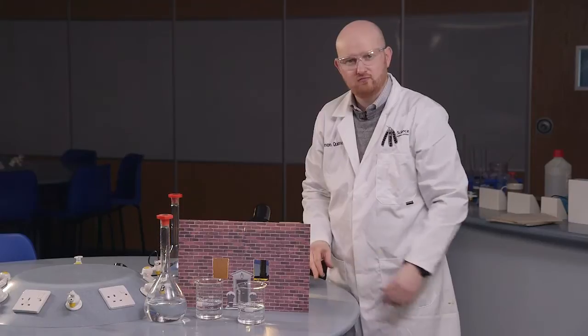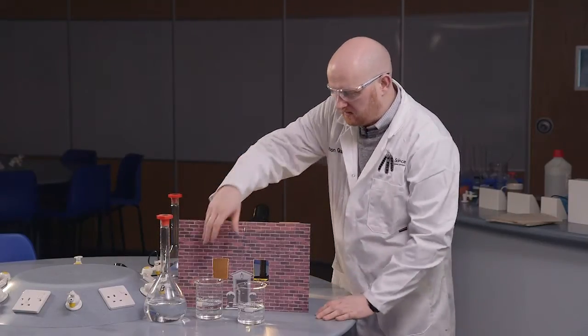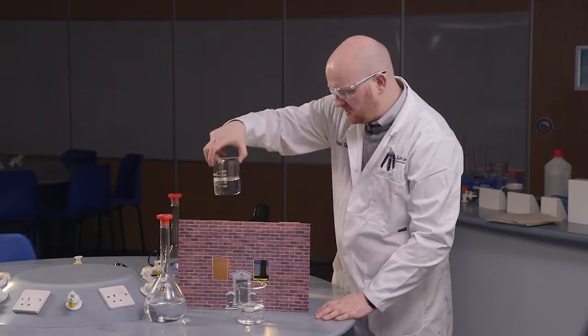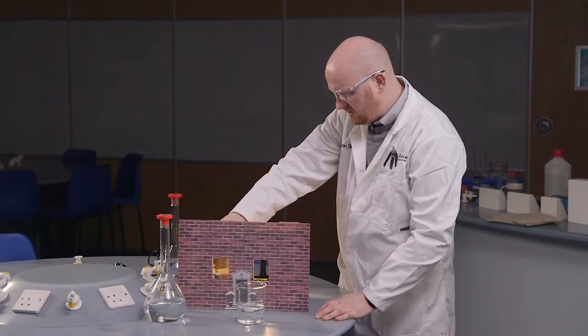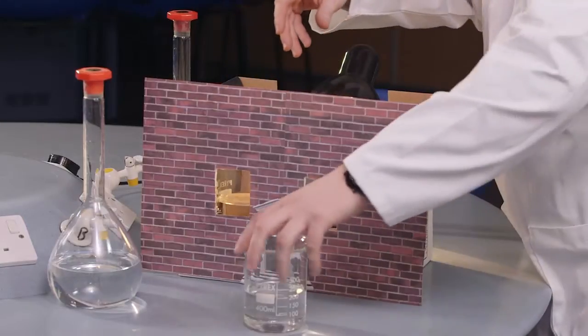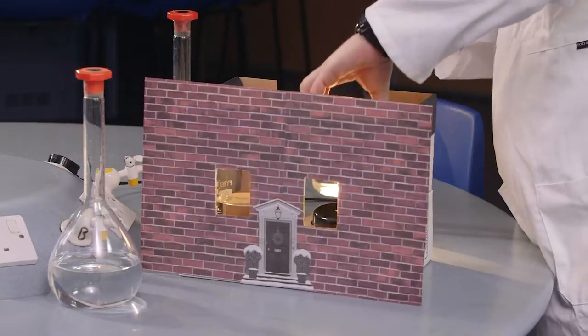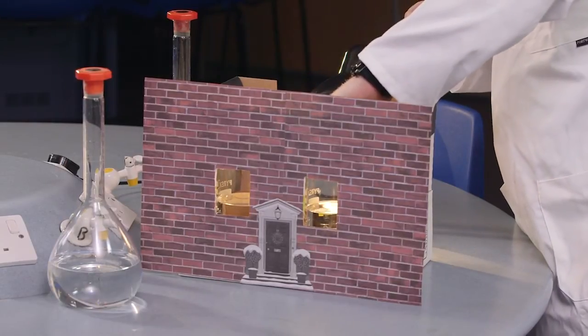I'm going to turn the light on so we're nice and ready. So we're all awake on Christmas Eve and I'm going to put these beakers just behind the windows here and I'm just going to make sure that we don't really see the writing because I think that ruins the effect slightly. There we are.